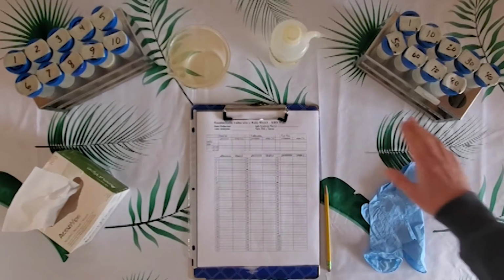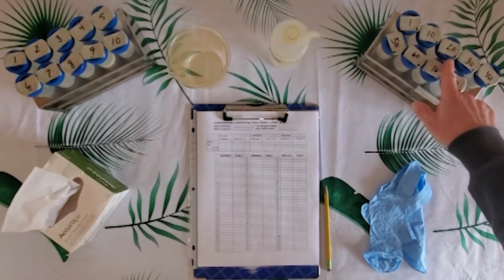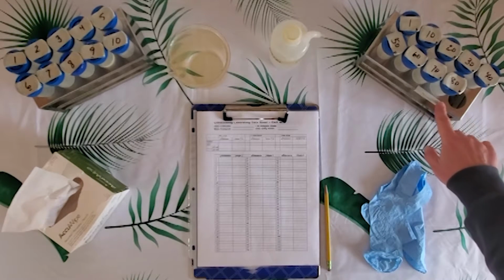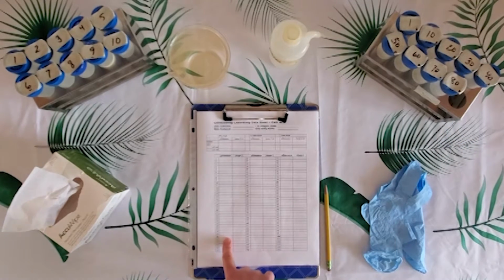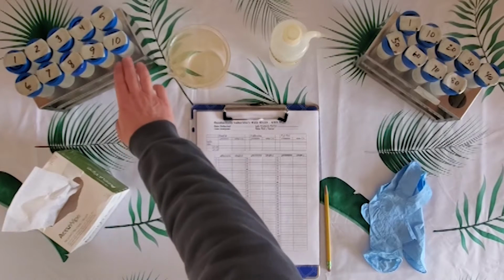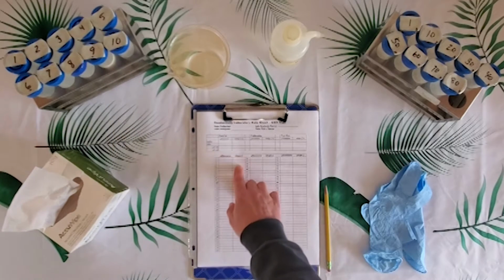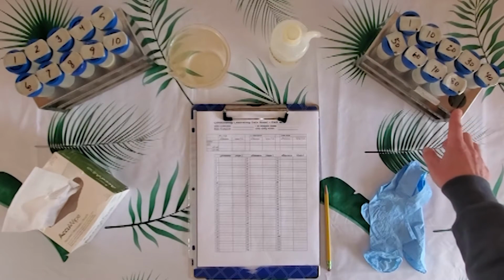In addition to those racks, we have the dupes rack, starting with 1 and then proceeding every 10 after that. You can see down here labeled in the corner is a small d, as well as dupes here on the rack. Moving over to the data entry form, this first column will contain the readings for these 7 to 8 racks, while this dupes column will be for this dupe rack.